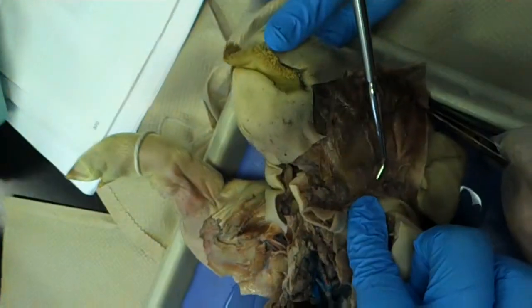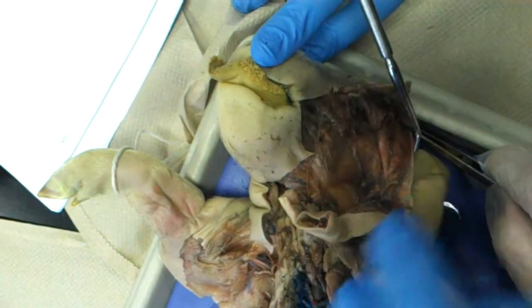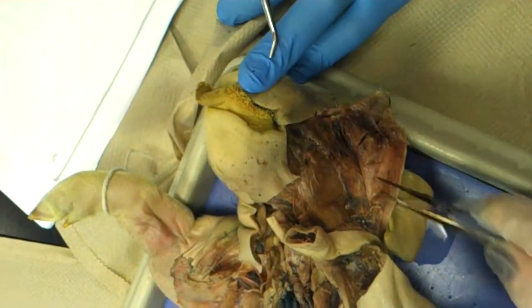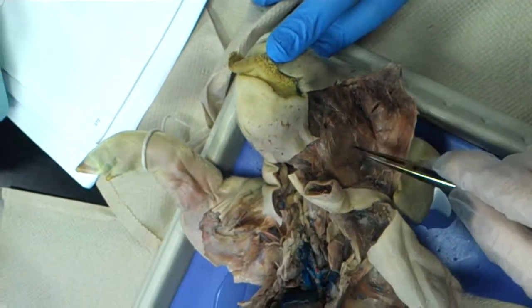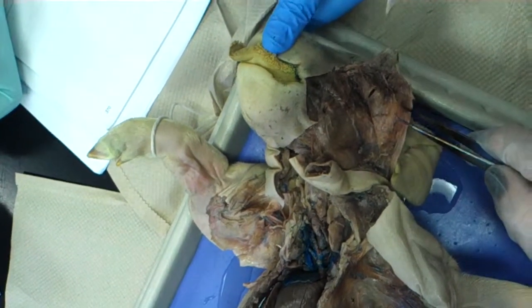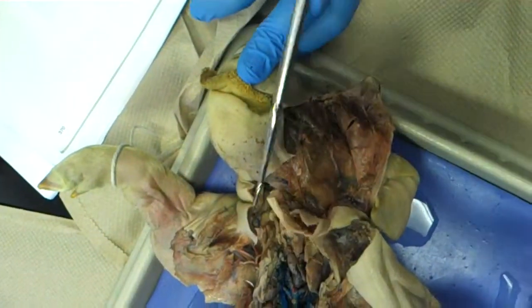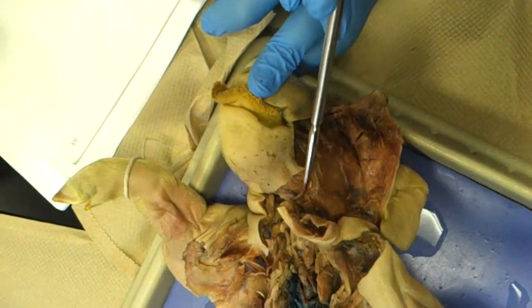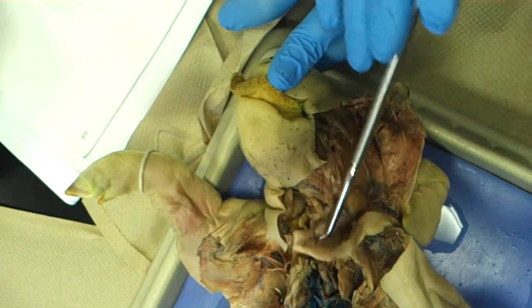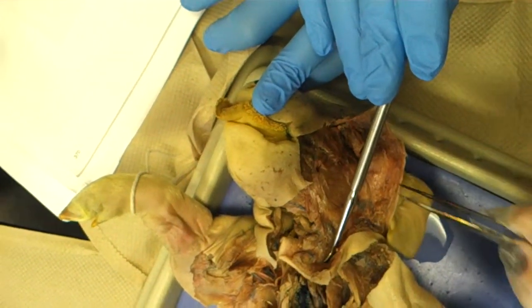Because like this is really, really soft. And there should be something that's like — the way it looks, it's just one little section that's the submandibular gland. Well, the mandible should be here, so it should be down here. And then the very bottom, towards the mouth, would be the submandibular.